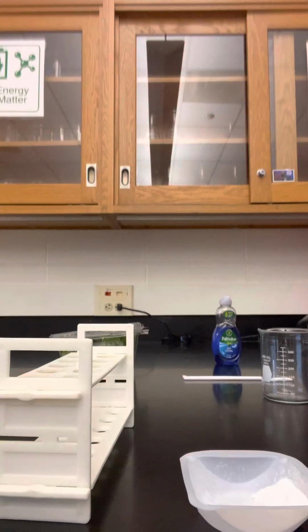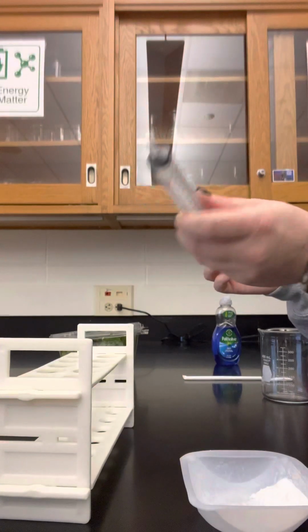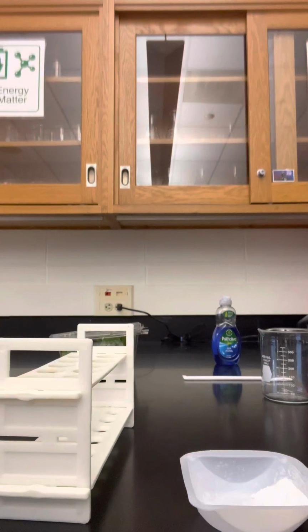And you need to establish your control group and your experimental group. Your control group is normal. That's the one you're going to subject to normal conditions, so you'll just set up the lab as instructed in the procedure. And then you'll set up your other syringe. So you're going to have two syringes, one control, one experimental.